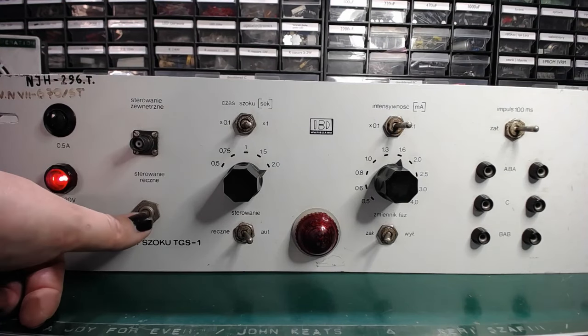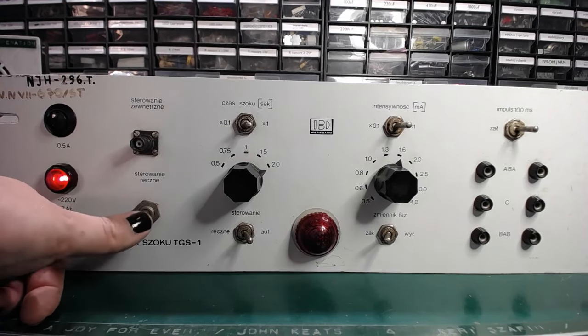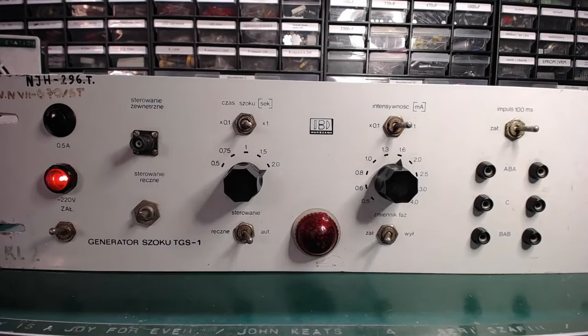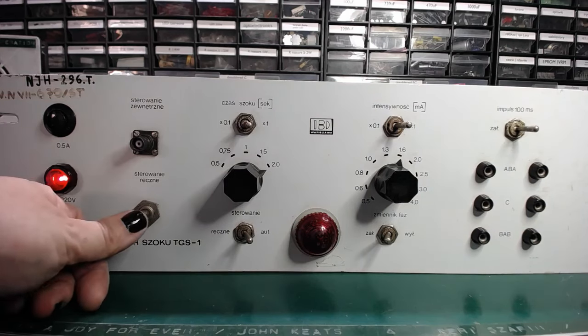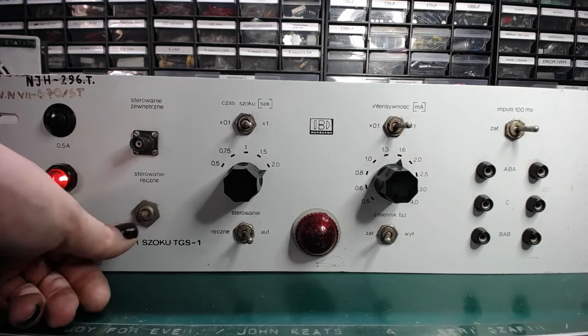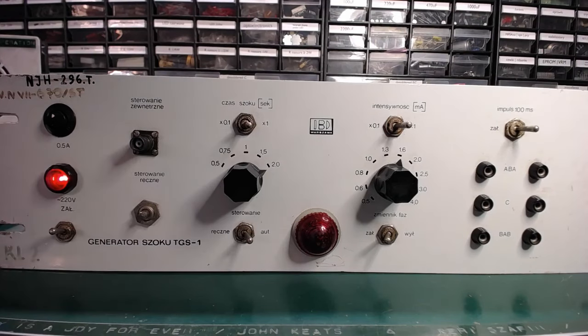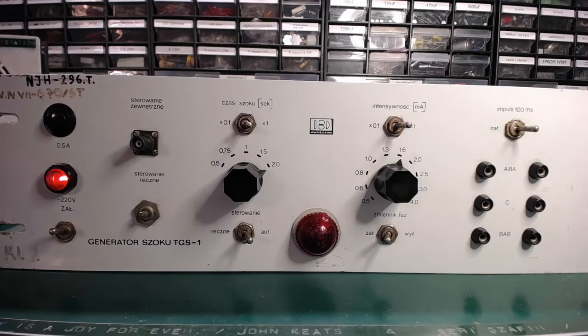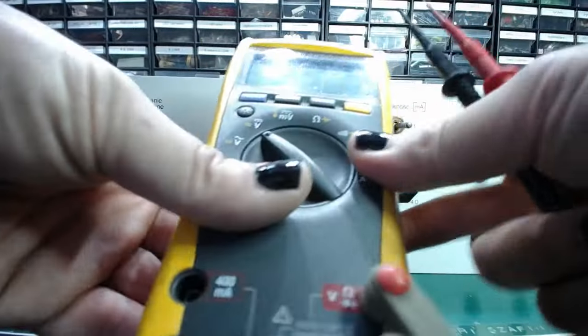What if I press this button and don't hold it? The timer will automatically measure the shock duration. So I can apply a short pulse to the input. As a matter of fact, this is a negative pulse because the input is pulled up to plus 13 volts.